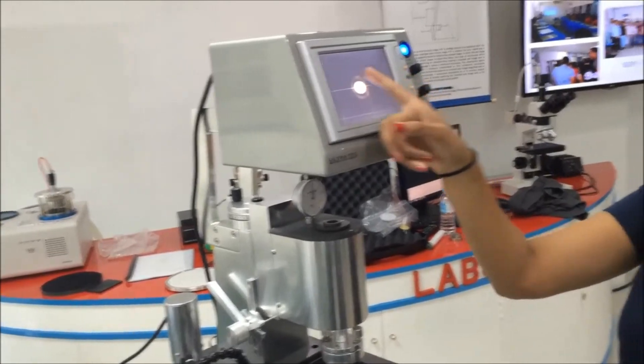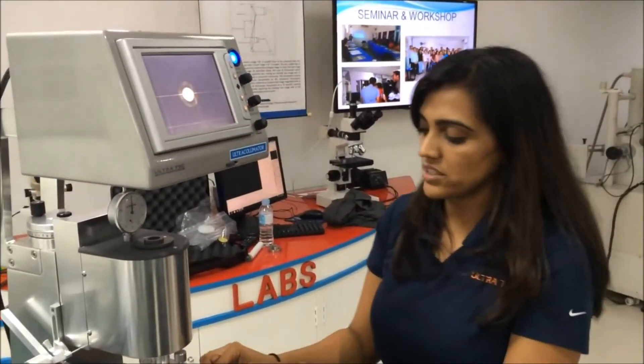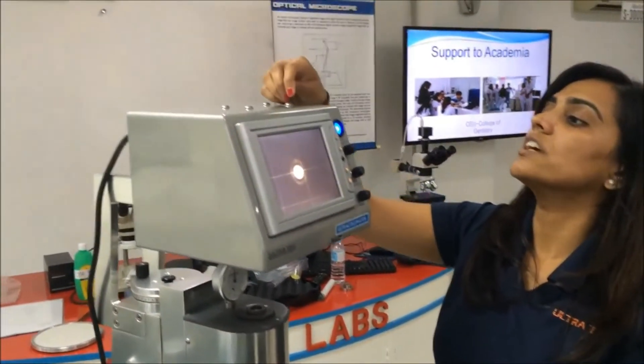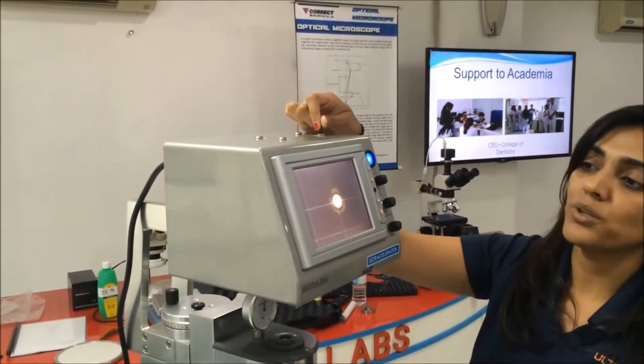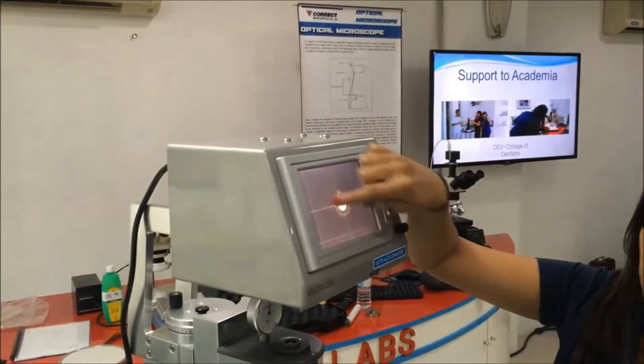And if you want to move that dot to any part, you can still adjust using top screws to bring it to any center calibrated point.